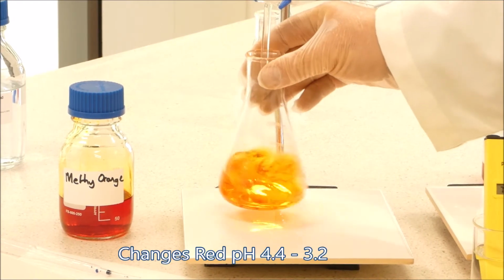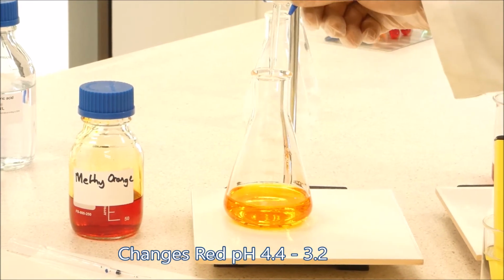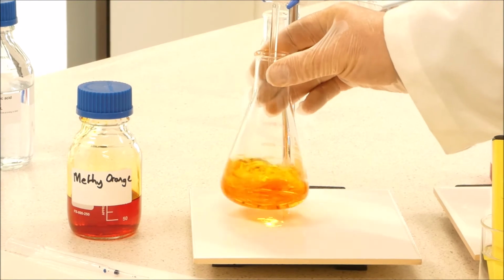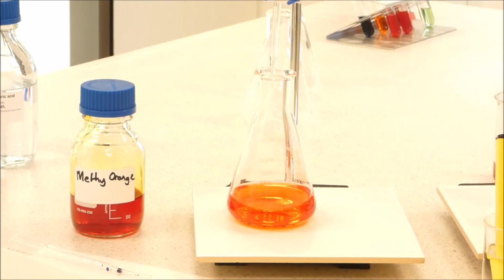Add a little bit more. It's still going back to an orangey colour, so it hasn't reached the end point yet. Add a little bit more. You can see that red forming. Add a little bit more, and you can now see the colour has changed to a ruby red colour.